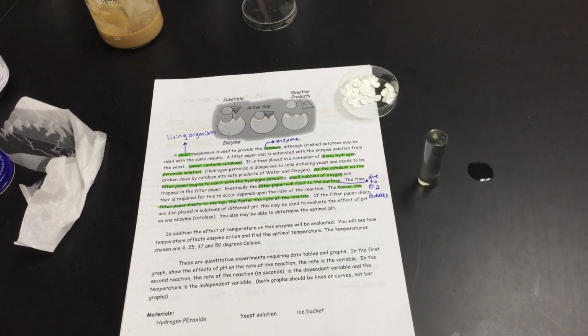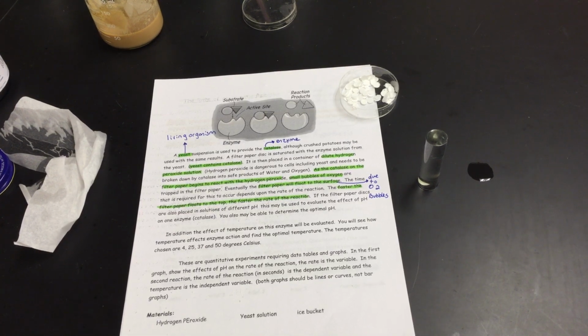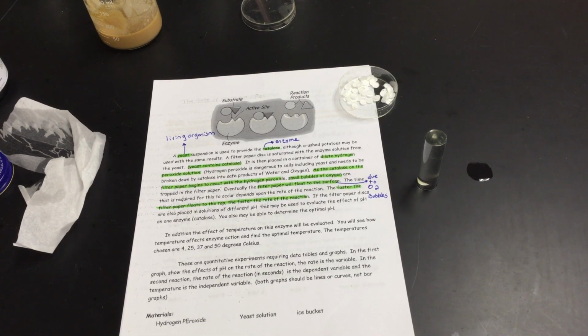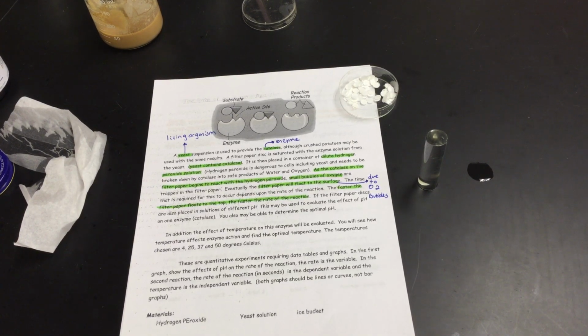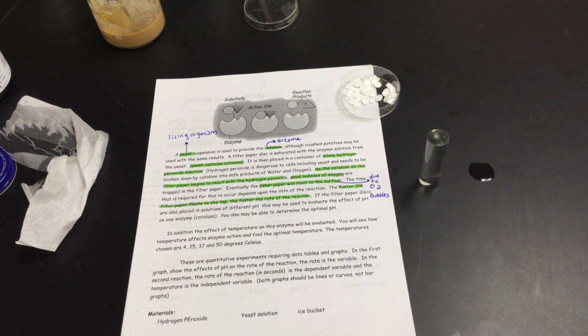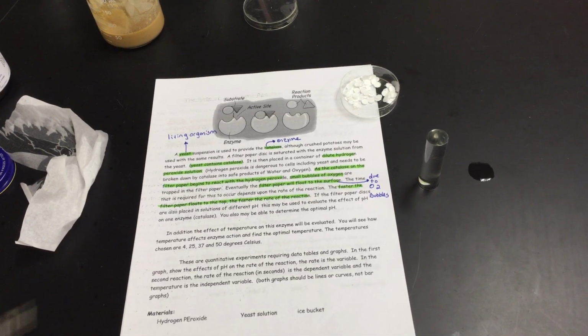So we're going to start my timer when the disc hits the bottom, and we'll stop my timer when the disc comes to the top. For each one of my solutions, 3, 5, 7, 9, and 11 in terms of my pH. Anything over 4 minutes, we're just going to call it at 4 minutes so we don't sit here all afternoon. We're going to do 3 trials for each of them, and then you guys are going to be averaging them out. So I'm going to do 3 trials for pH of 3, 3 trials for pH of 5, 3 trials. I'm going to try to do them all at the same time for you.